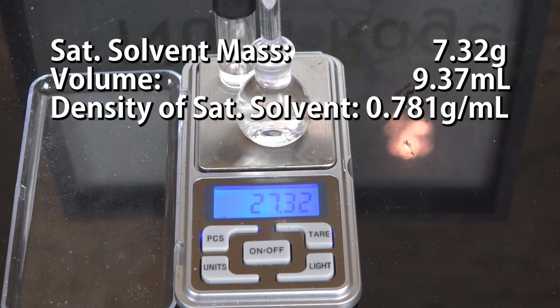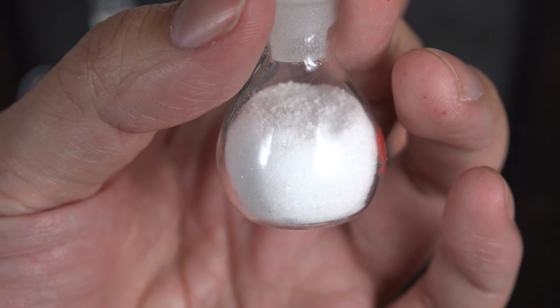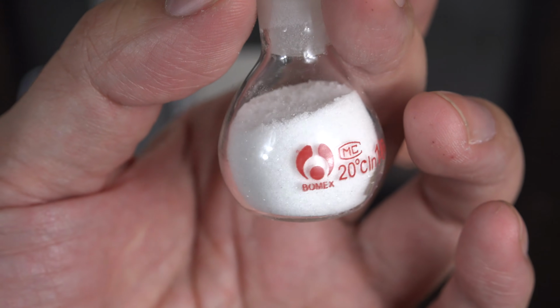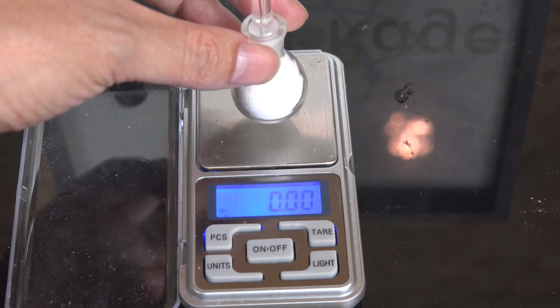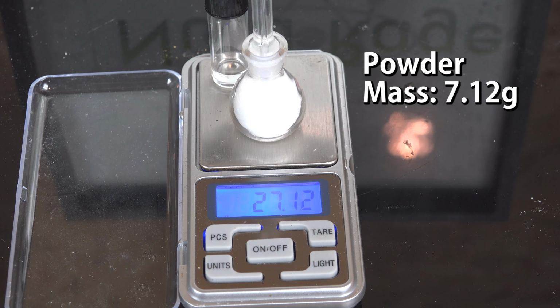Once we have that, we can start on our powder. We empty the pycnometer, clean it and dry it, and then fill most of it with the powder. The more we have, the more accurate we'll be. But leave some room so we can fit the stopper later. Now we find the mass of the powder we just added. As you can see, this companion weight makes it really convenient.